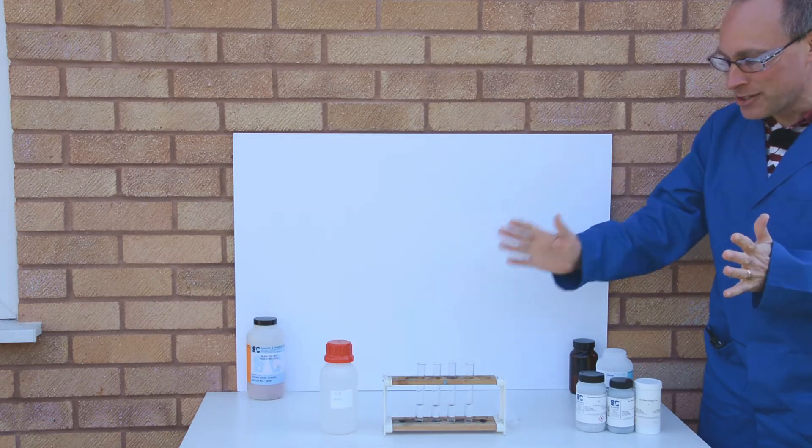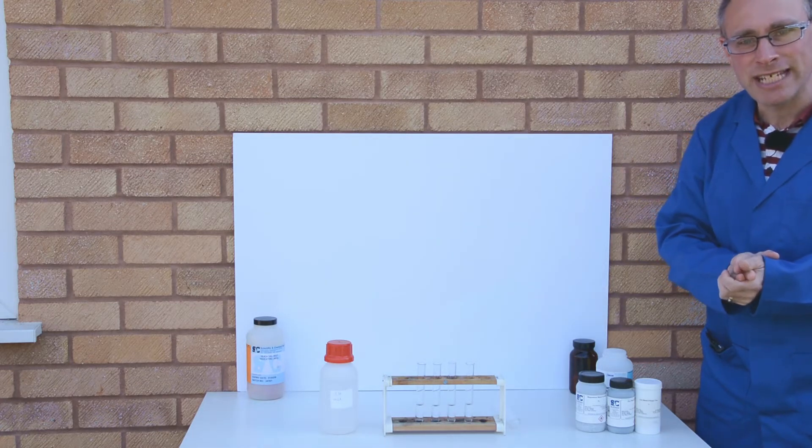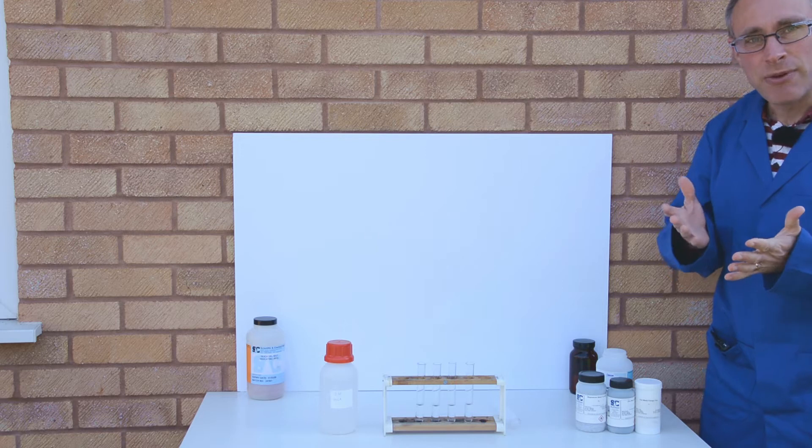In this experiment, we're going to have a look at the reactivity of some different metals with dilute acid.